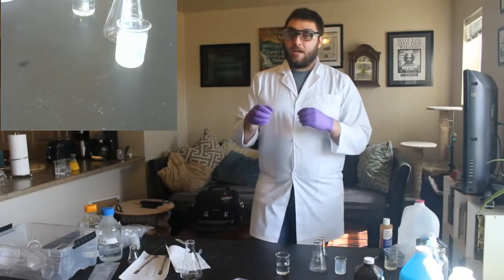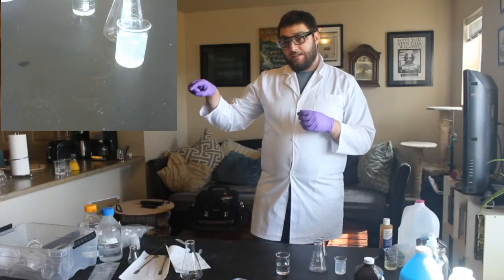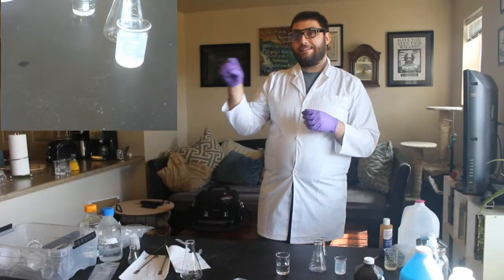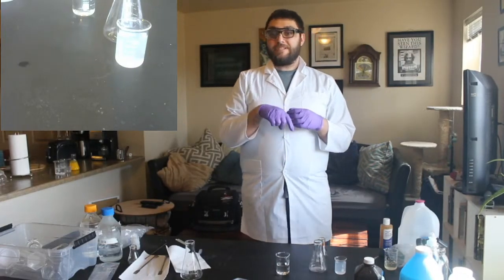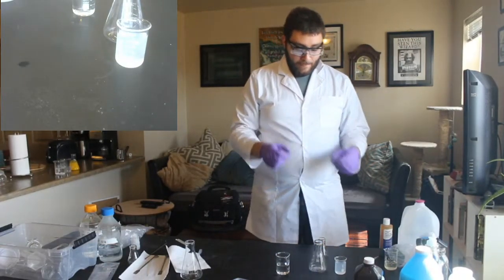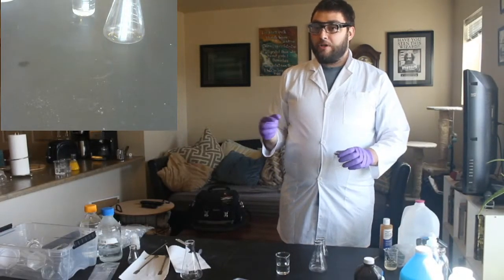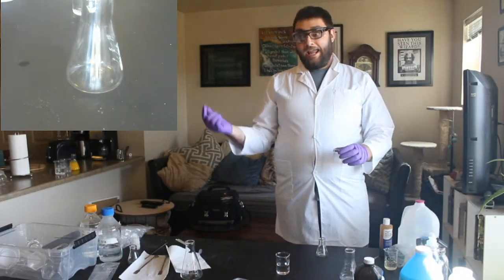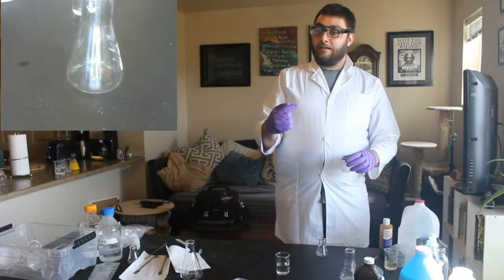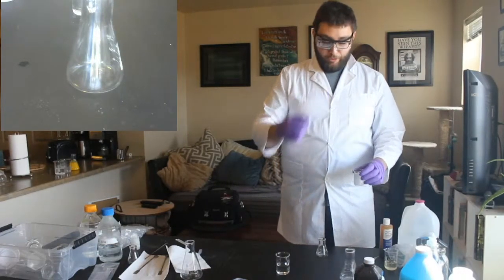So if we break away all of that vitamin C, that iodine will come back. The iodide will turn back into iodine because the vitamin C goes away and it goes back to where it started. So when we mix these together, we should see that the iodide will go back to iodine, and if there's iodine and starch around, it should turn blue or black.